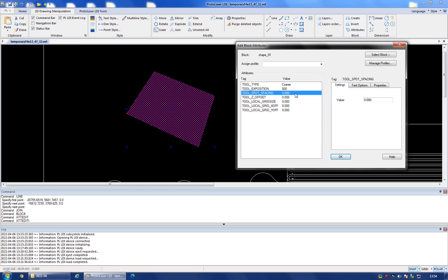And this spot spacing setting allows you to set an additional offset between the different dots which the laser writer uses to do the exposure. Then you have this setting about the Z offset. This is useful if you're having very, very thick films, say 50 micrometers or even more. And you can adjust the laser focal plane compared to the leveling procedure that we will do afterwards.